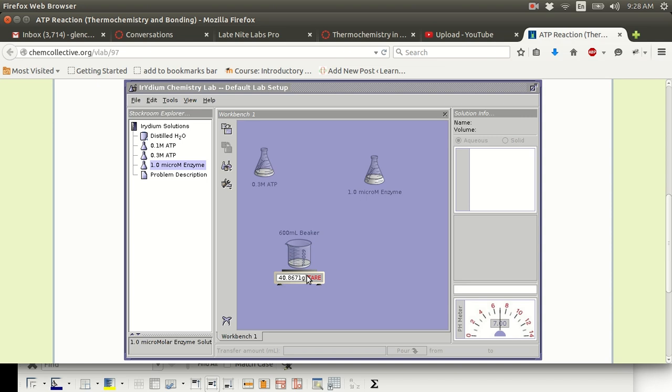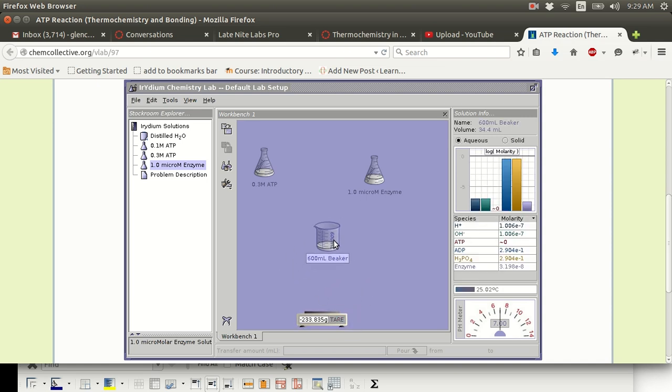Okay? Okay. Now for the problem of that temperature. So what is a good way to prevent the beaker from cooling off so quickly? You see it's almost at 25 now. There is a way to do this, and I'll show you now.